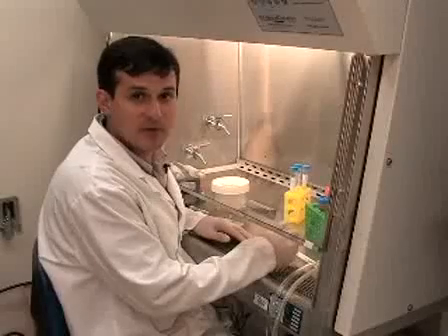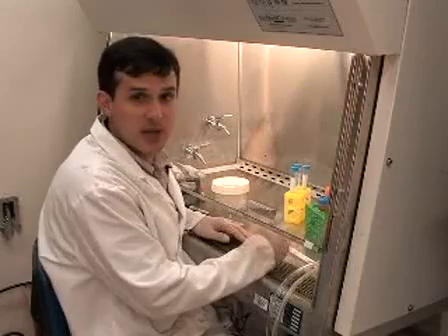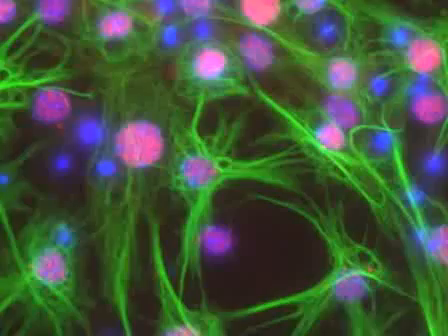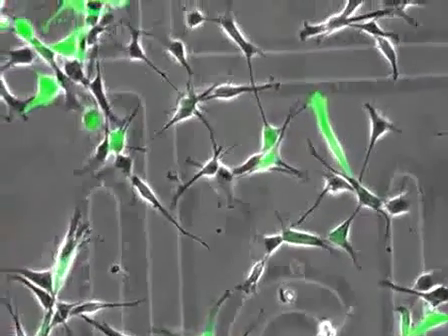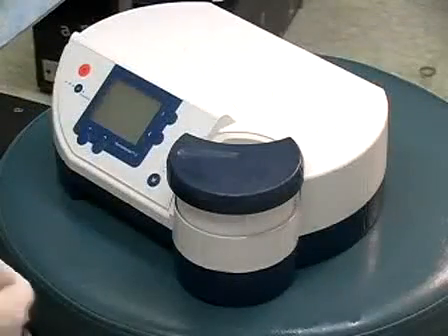Now I'm going to show you how to count human neural precursor cells, and you would count your cells when you want to plate them for immunocytochemistry or when you want to do a transfection with nucleofection machine.